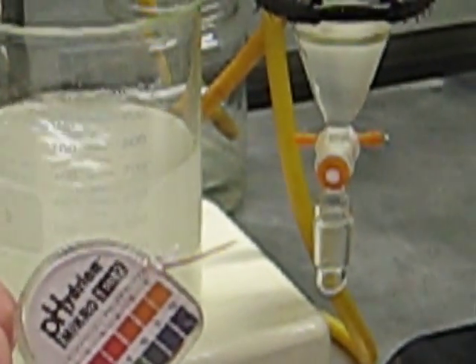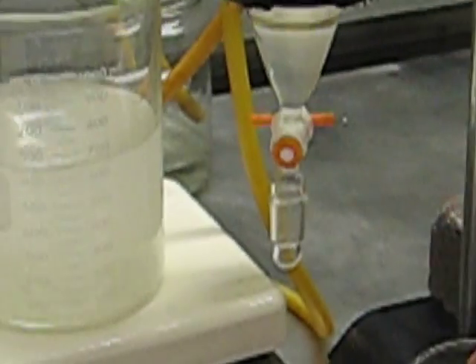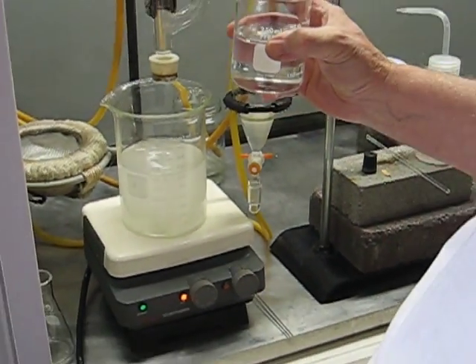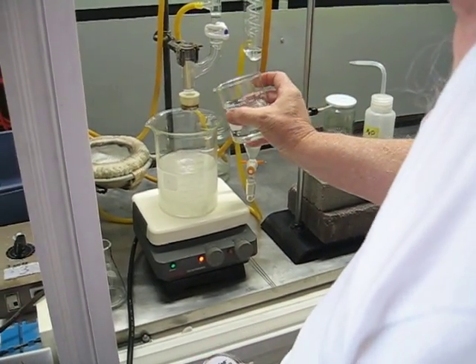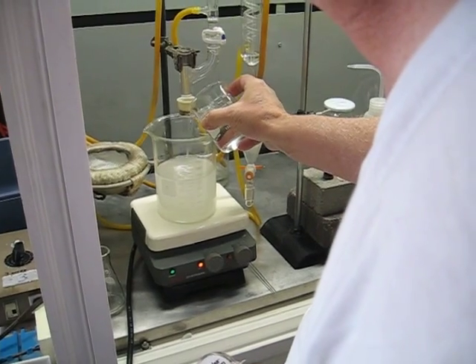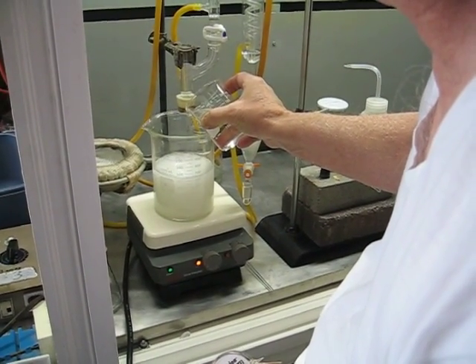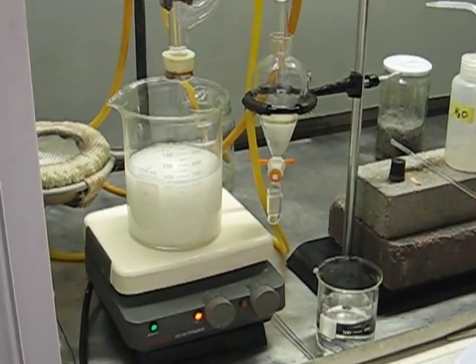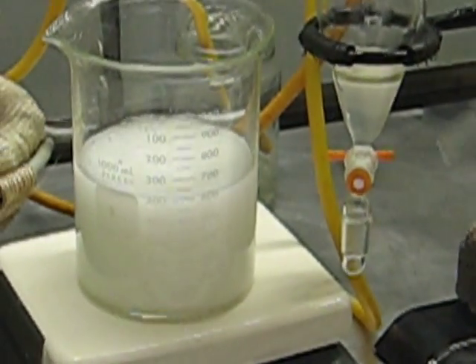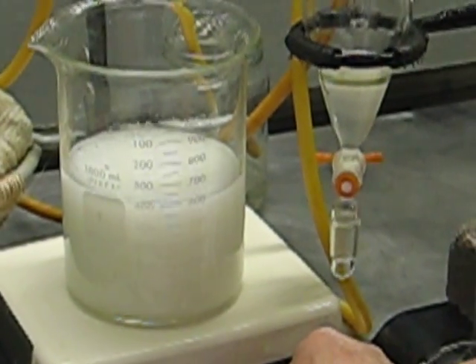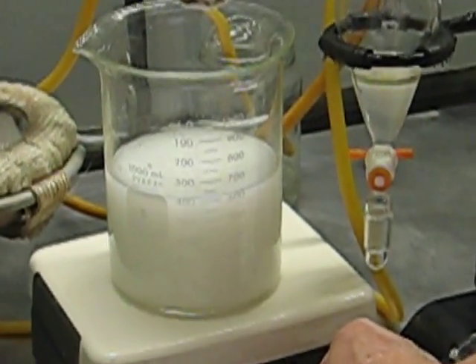Now, I am going to start adding some, about 6 molar hydrochloric acid. As you can see, it precipitated out right away. I'm going to turn the agitator up a bit here.